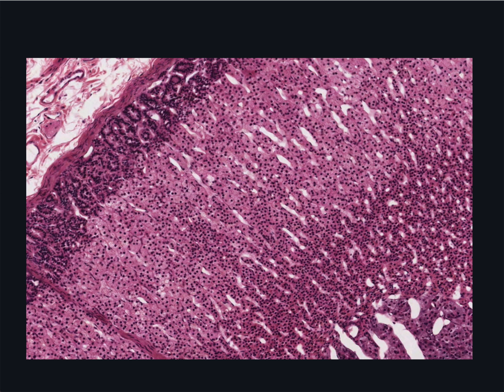The blood supply to these sinusoids in the adrenal cortex and capillaries in the adrenal medulla is quite unique. A cortical arteriole from the capsular branch of the suprarenal artery branches into capillaries that may be followed in a straight path from near the capsule to almost the boundary with the medulla.